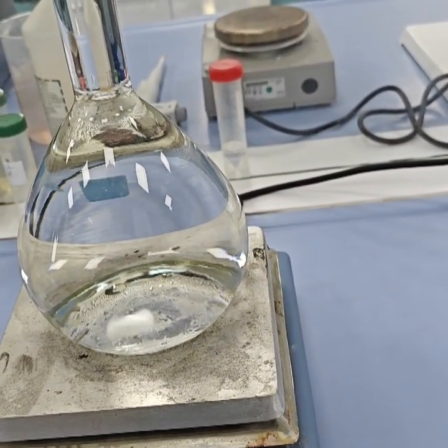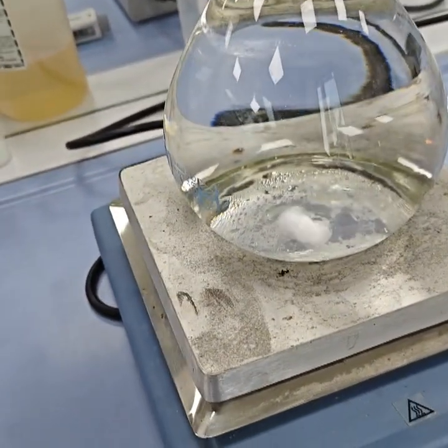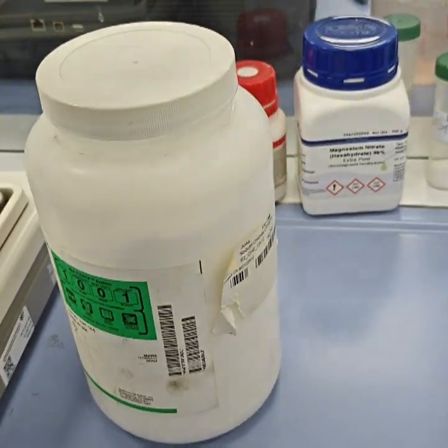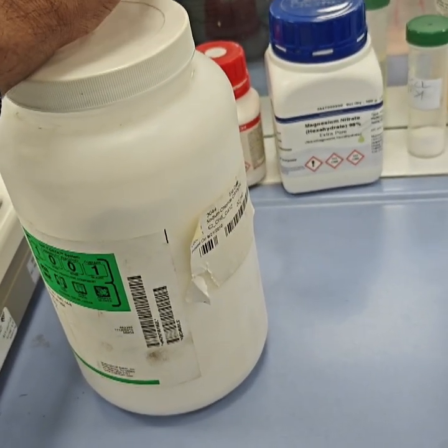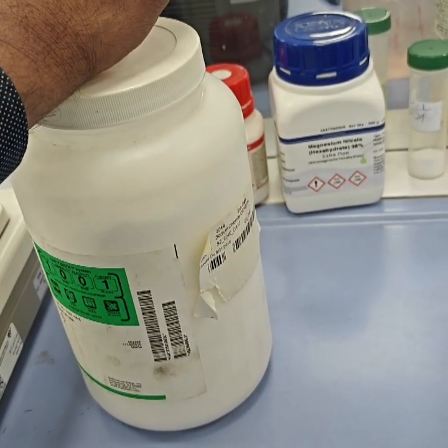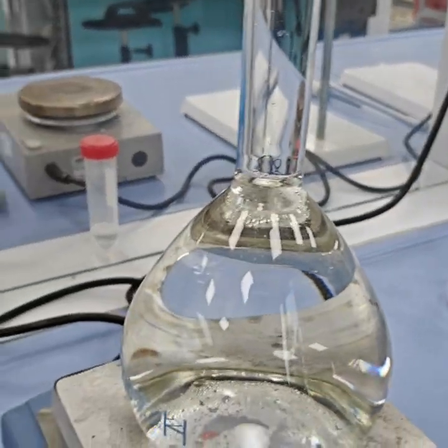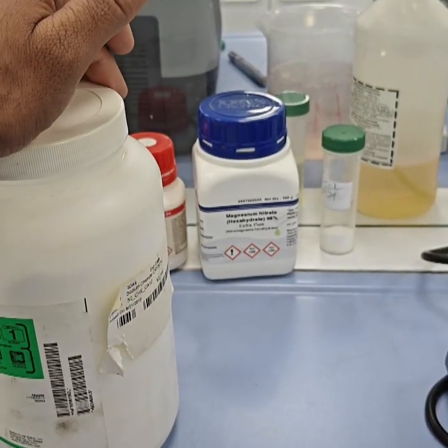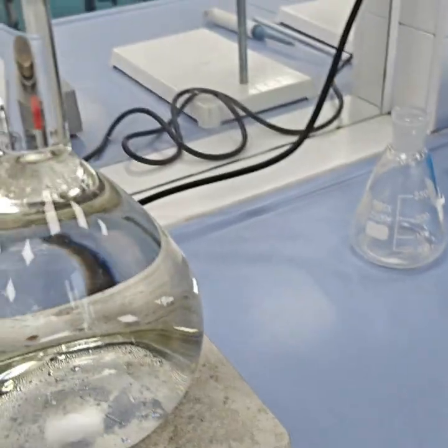And why is it important to determine the zeta potential or point of zero charge for adsorption studies? Here you can see that we have sodium chloride salt. We prefer this because it is inert and does not react. It gives a stable reading compared to other salts like calcium chloride, which is doubly charged, so there is a sharp drift in pH after doing the point of zero charge. It gives a false reading. Even sodium carbonate is not preferred. Usually we prefer sodium nitrate, potassium chloride and sodium chloride.